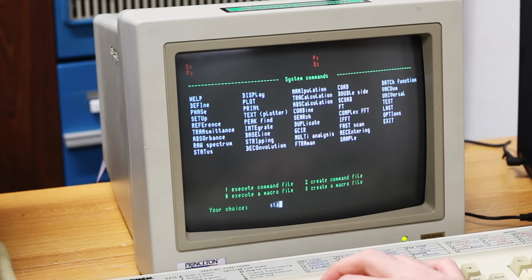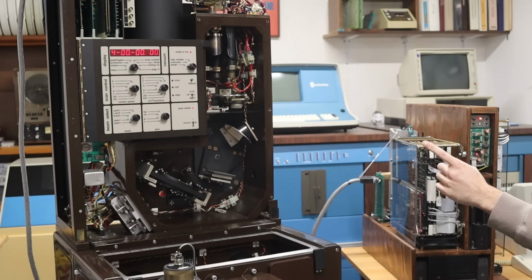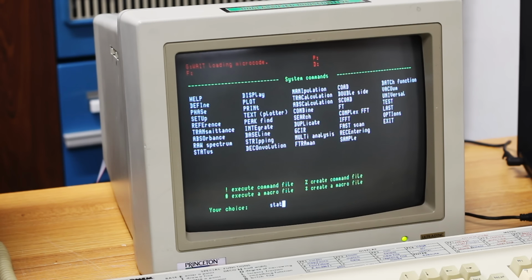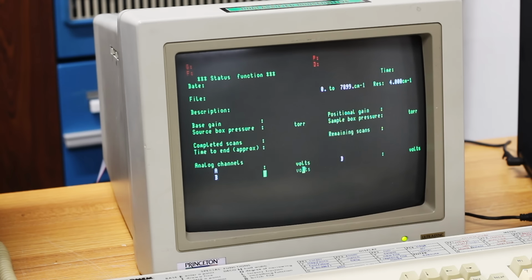And we're fully in here. There's a ton of options to do, but I think the first one we'll do is we'll just go to status here. So I'll do an STAT. This should communicate with the vector processor and hopefully the DA3 over there. It says loading microcode up here. I can't see, nope, there it goes.